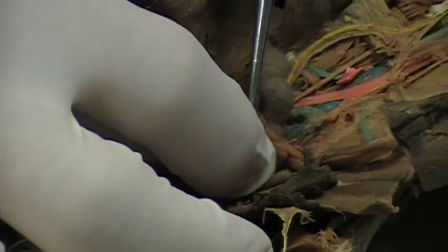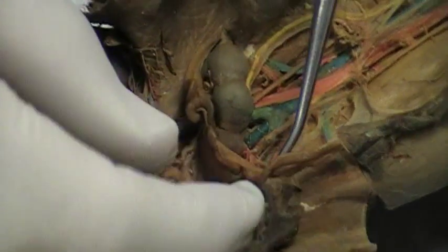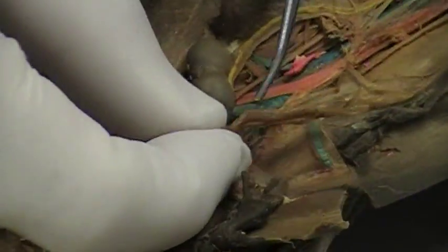This is the uterus right here. The uterus forks. This is the left horn right here — the left uterine horn — and it goes up.